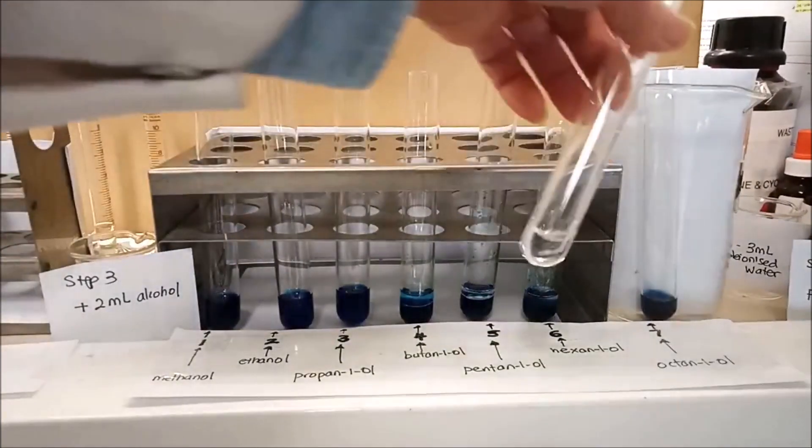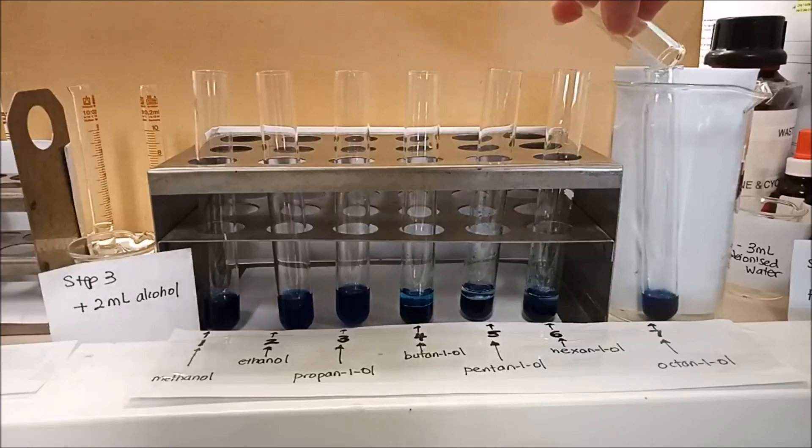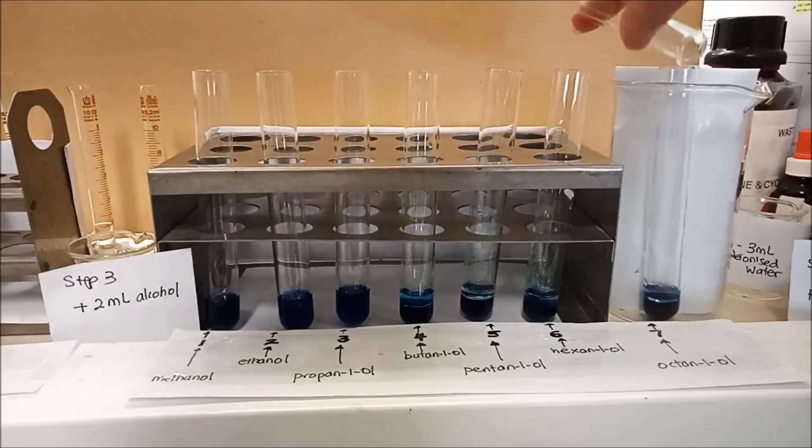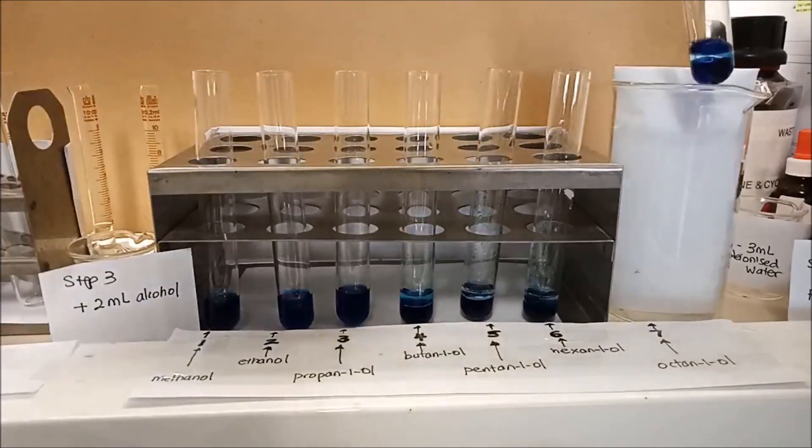Let's look at octanol. Two mils of octanol to three mils of water. And let's see what happens. Here comes again.